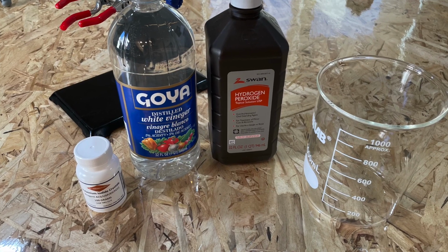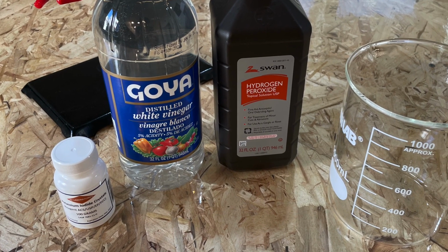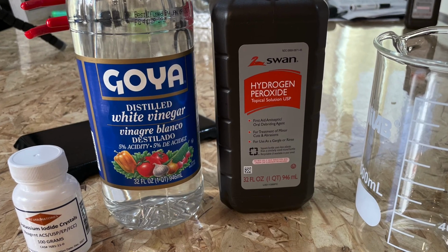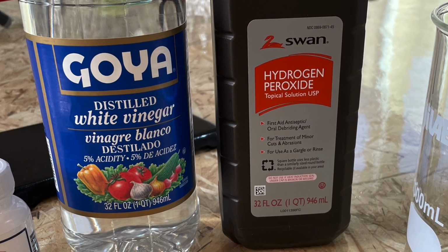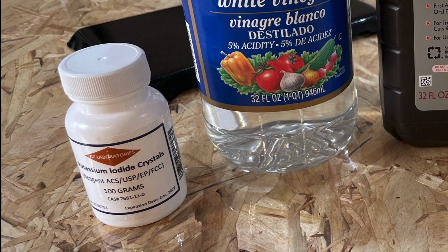In this video, I will be synthesizing iodine from potassium iodide, 5% vinegar, and 3% hydrogen peroxide. Both the vinegar and hydrogen peroxide can be obtained at a grocery store or local pharmacy. The potassium iodide crystals were purchased off Amazon.